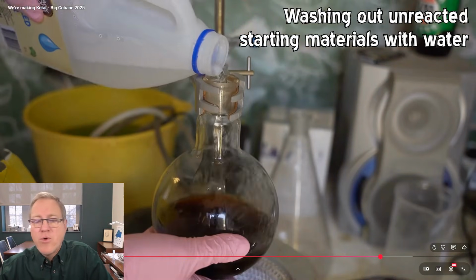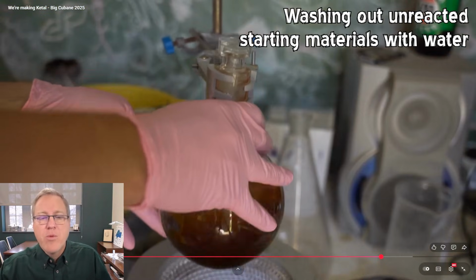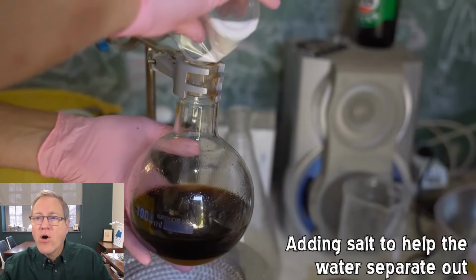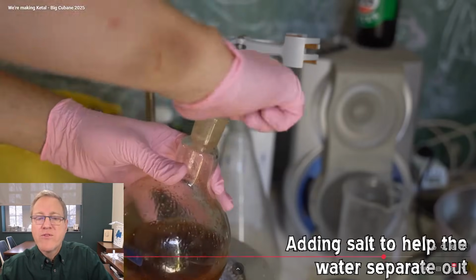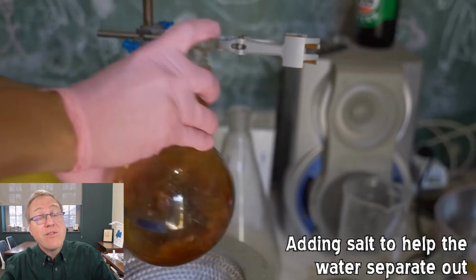Okay, here we go. So he's adding some water. Remember the purpose of that water is to dissolve the excess ethylene glycol. He's adding some salt to help give a phase separation between the polar and nonpolar layers. The polar layer will be the water layer, presumably containing ethylene glycol. The nonpolar layer will be less dense.